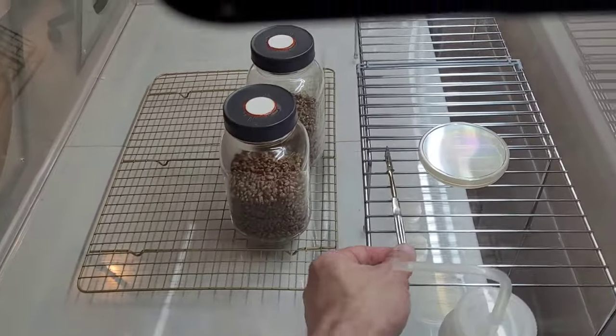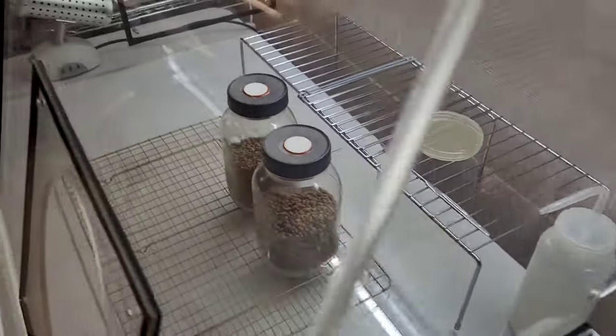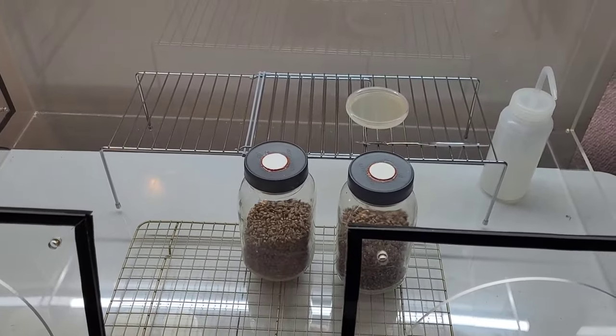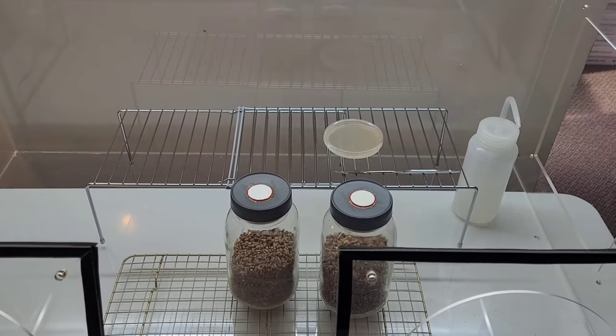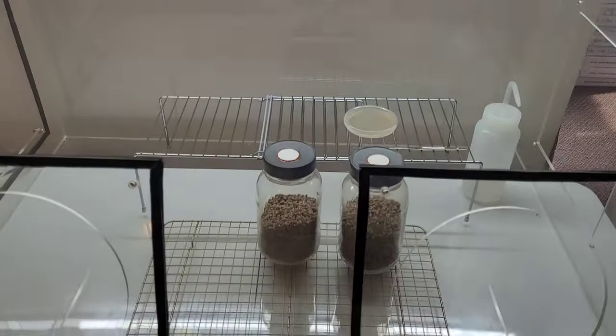When loading items into your still air box, have a basic idea of how you're going to move. You want to keep your movements as brief and conservative as possible. As the name implies, the air in here should remain as still as possible.